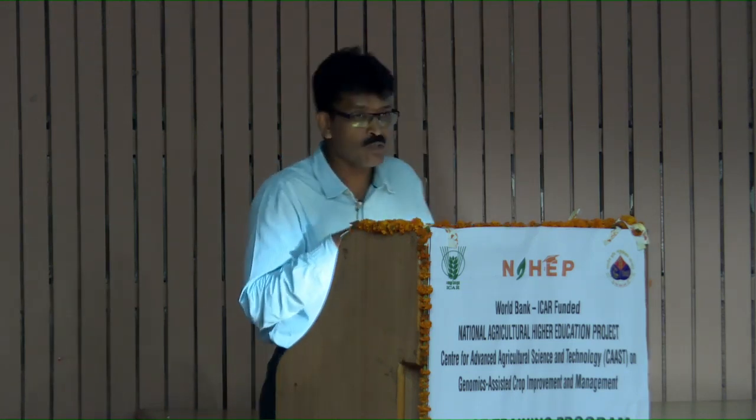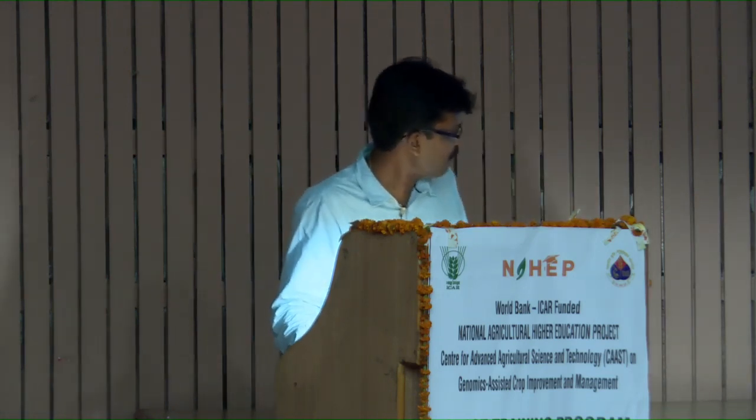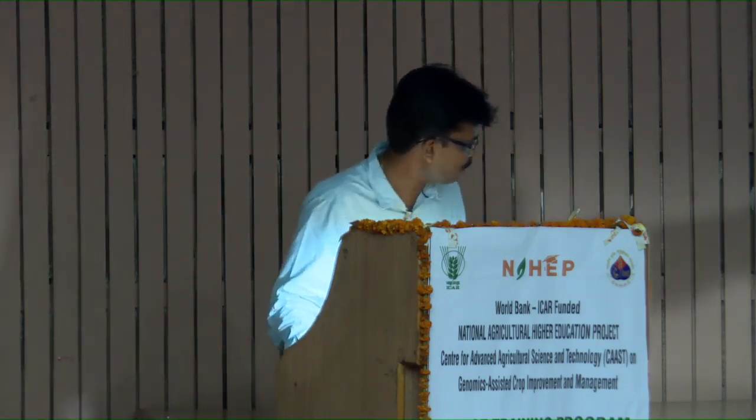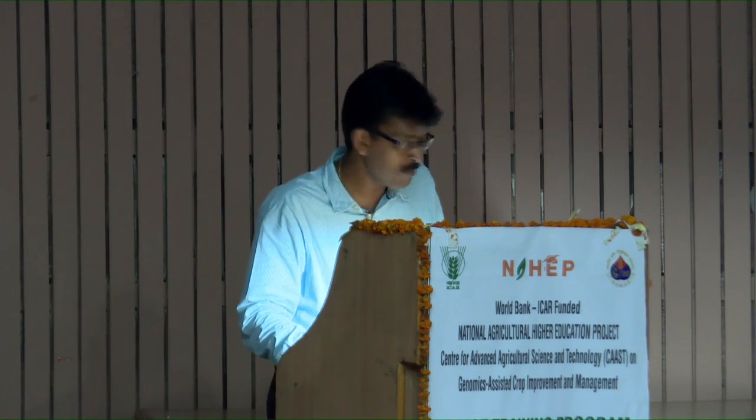Classical examples of probe-based detection include the TaqMan probe — very popular — molecular beacons, scorpion primers, and hybridization probes. These are variants in probe-based detection, much like the variants in dye-based detection. Let us take one example: the TaqMan probe.